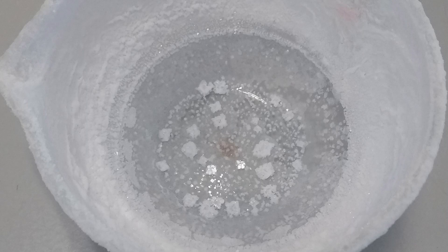The image on screen shows an example of sodium chloride crystals produced using this method. This method also works for producing other crystals such as sodium sulphate or ammonium sulphate.